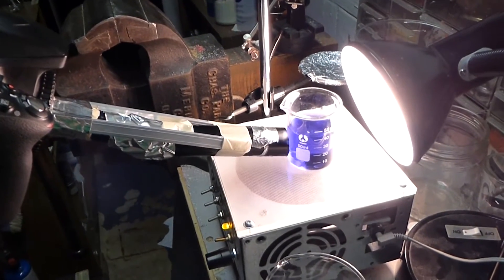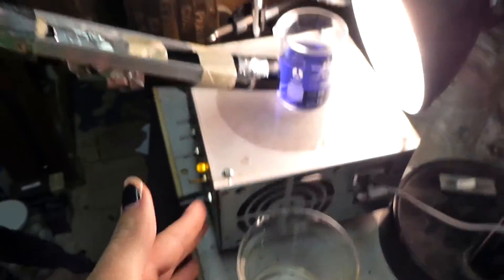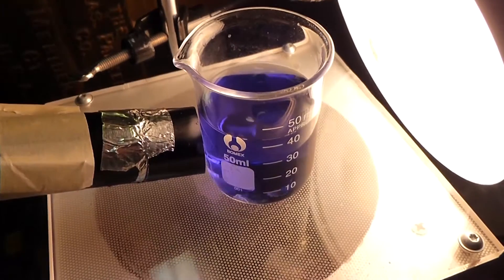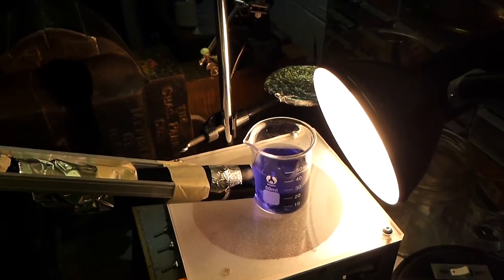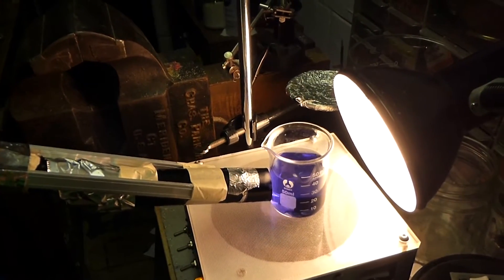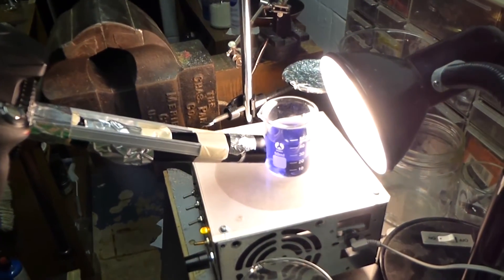In this video I'm going to be doing a spectroscopic titration where I have my spectroscopic camera right here, a light source, magnetic stirrer, and a regular camera overhead. Right now in the beaker I have sodium hydroxide solution with universal indicator, and I'm going to add hydrochloric acid dropwise and show the color change as the indicator goes from the basic to the acidic environment via both of these cameras, showing them both combined together. Enjoy.